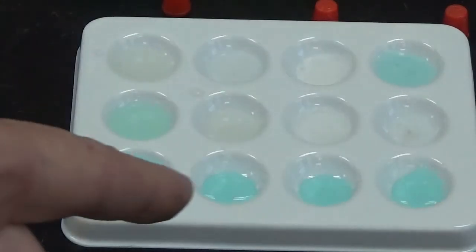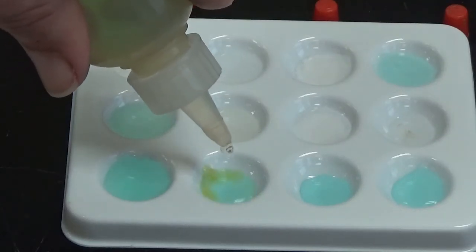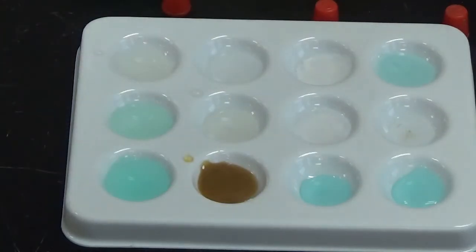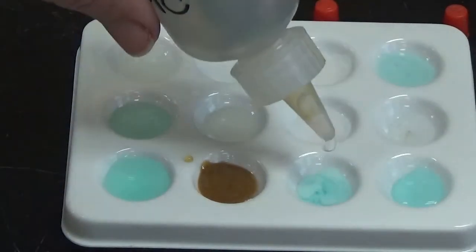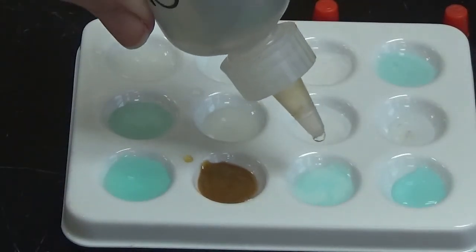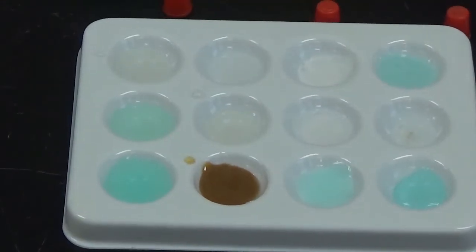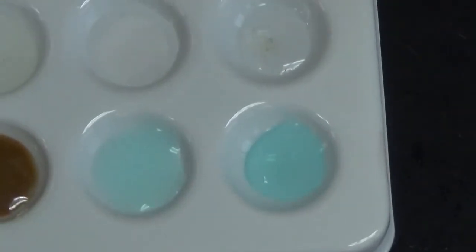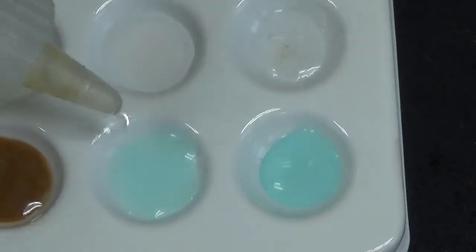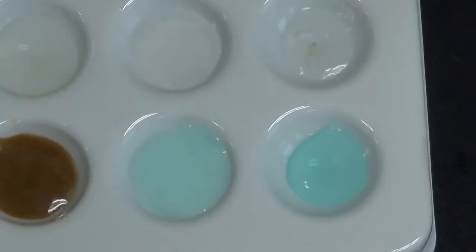Alright, so next up I'm going to add in potassium iodide. And most definitely a color change. Then I'm going to add lead 2 nitrate to this well. And you have a nice white solid that forms in there. So that one's probably a little hard to see on the camera. So when I go this way, let me see if I can drop it in there while you're looking. You can see some of that white forming as the swirls go around.